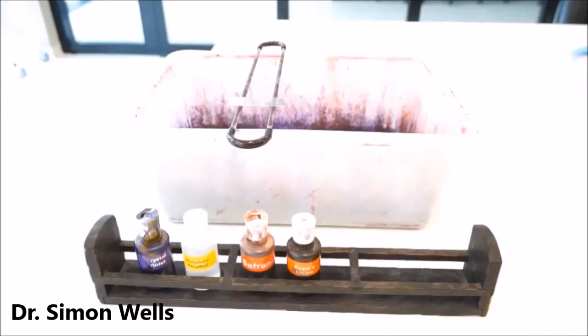Now I'll demonstrate the procedure for the Gram stain. This stain is one of the most widely used microbiological stains in the world. It's simple, it's fast, it's effective, and all of you will probably get it to work.